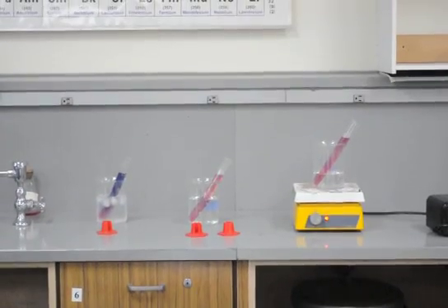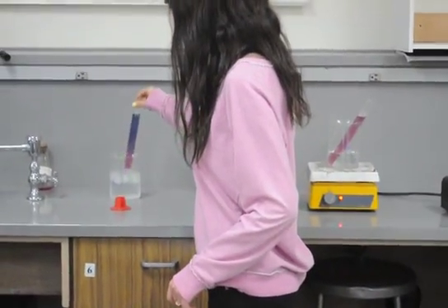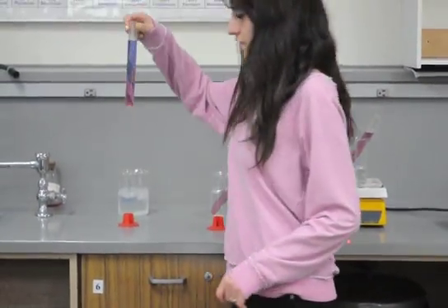So, Chate, go ahead and lift up that blue water tube, and let's see what's going on. Yeah. Pull it out. There we go. Thank you.